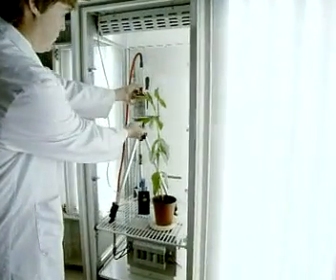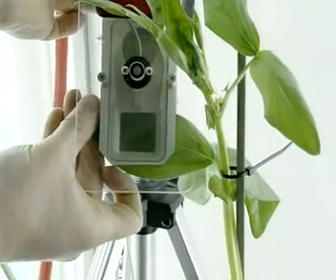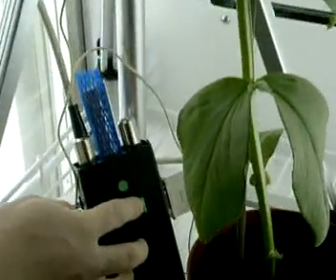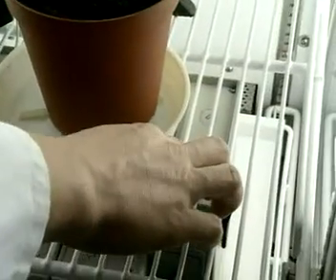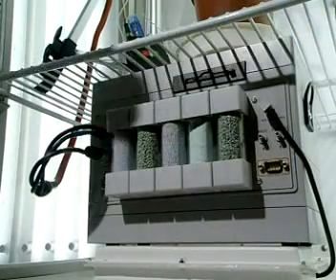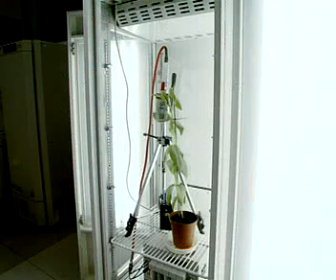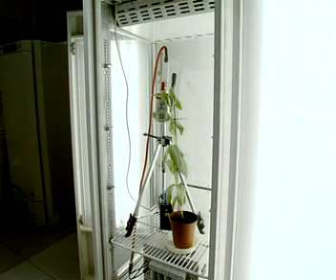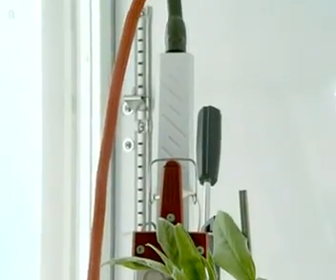Just one leaf is carefully placed in a computerized gas analyzer. This measures the rate of photosynthesis by calculating the amount of carbon dioxide taken up by the leaf. Air is drawn in through filters and its CO2 content is measured automatically. The air passes up to the leaf and back down again through the red tube, and the CO2 level is then measured again.